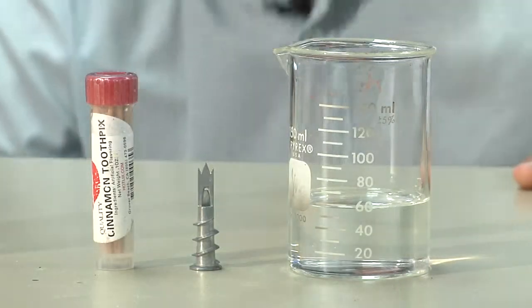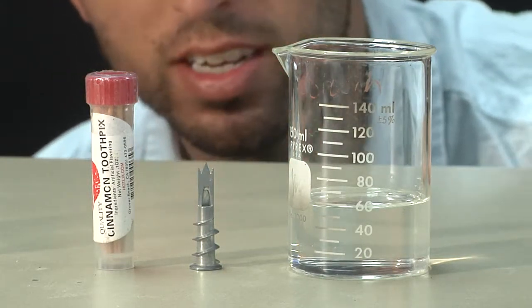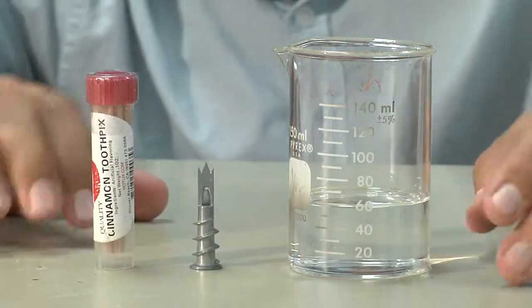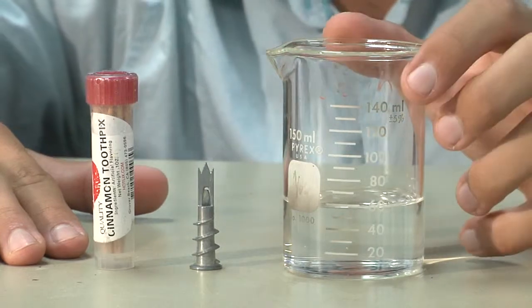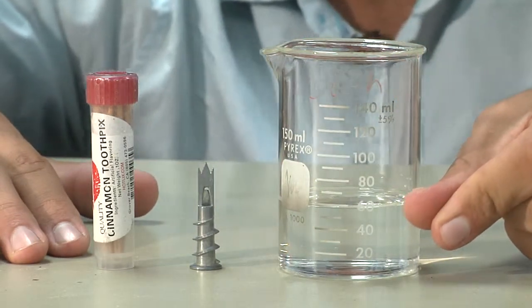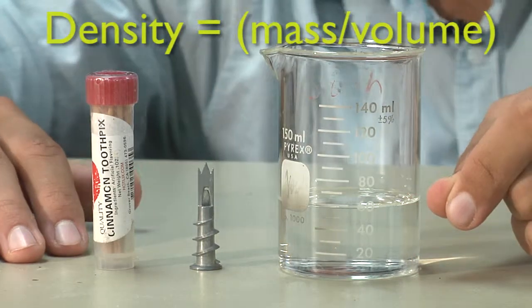So what is density? Density is the measure of how much mass is in an object in a specific volume. To measure density, we take the mass of a sample, for example this water, and then find how much volume is in that mass, and then divide mass by volume. Let's walk through a problem.